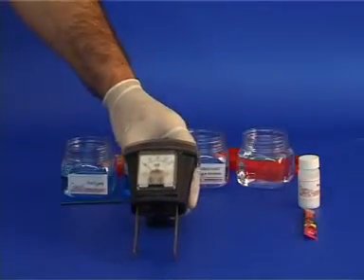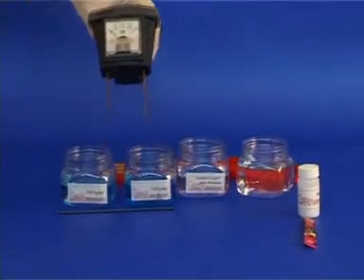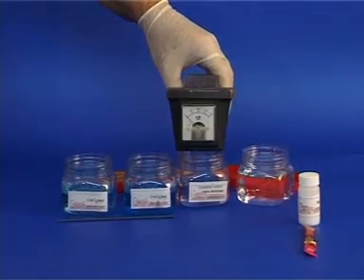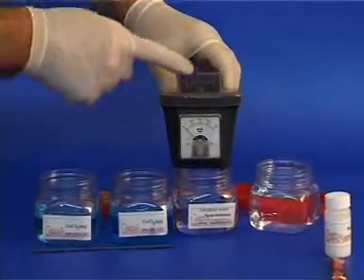If you have the device with an ammeter, you will be able to see more details. Note that the bulb does not light up and the ammeter needle does not move in the case of distilled water.